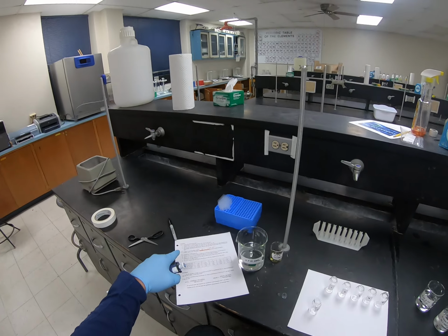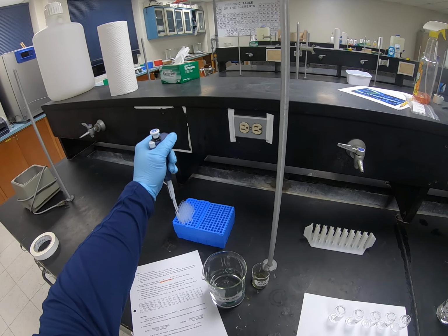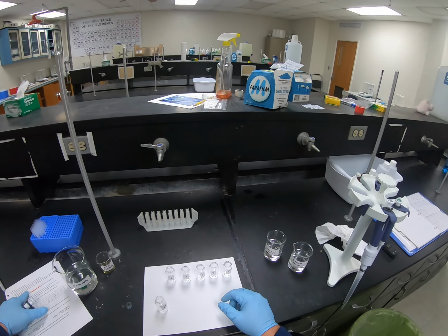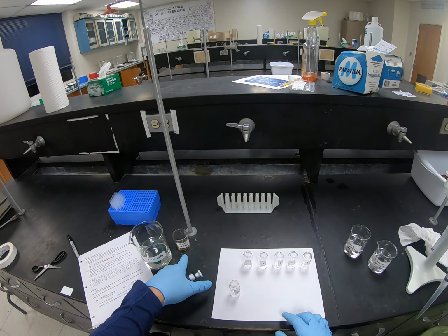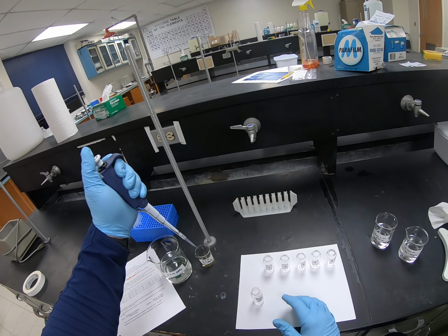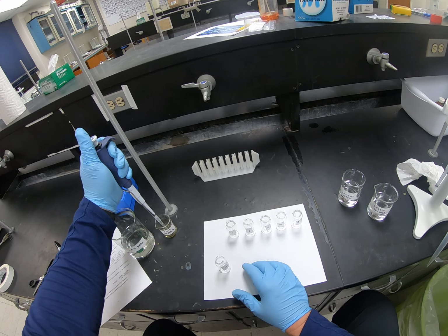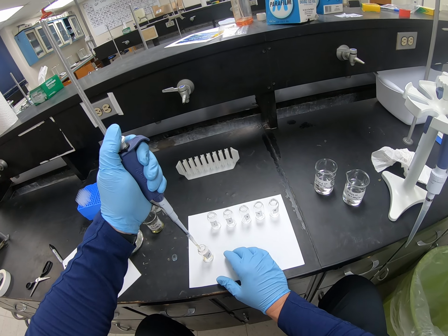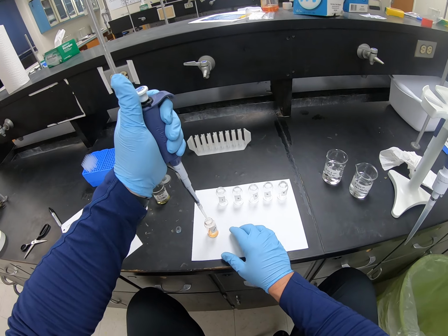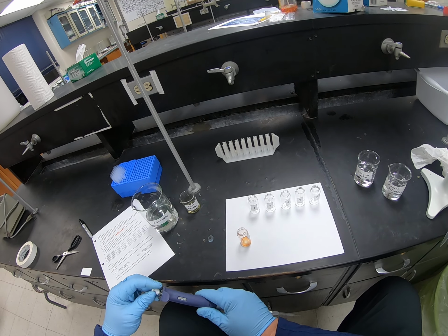Okay. My next reagent is 2.5 mils of the 0.2 molar iron nitrate. So this is the 0.2 molar iron nitrate. I'm going to put 1/2 ml in there first. So I put the 1/2 ml in, and immediately I see a color forms in the vial. So now I'm going to put an additional 2 mils.